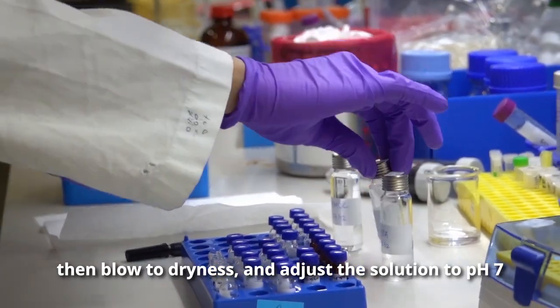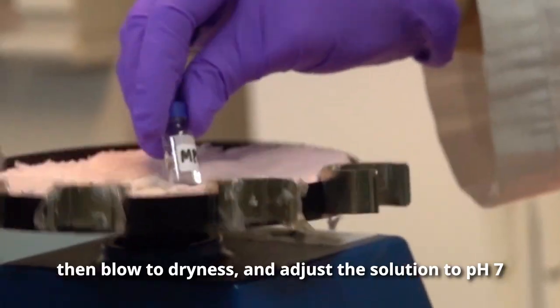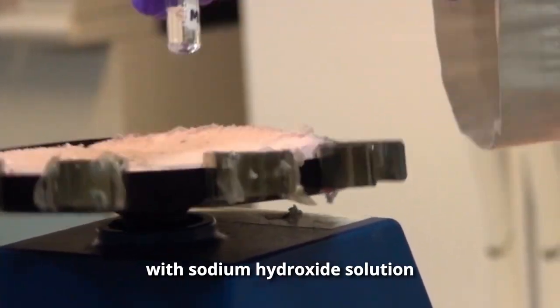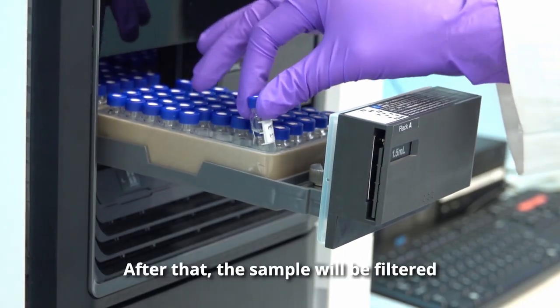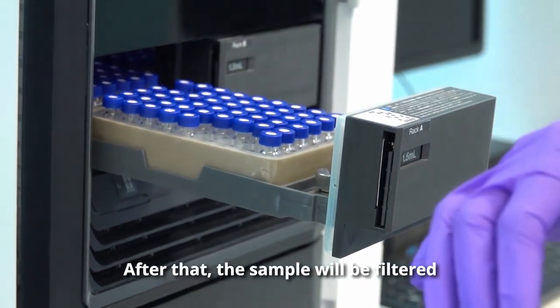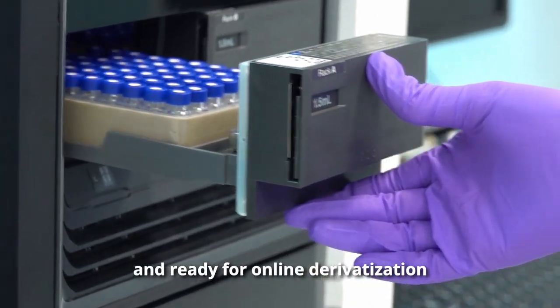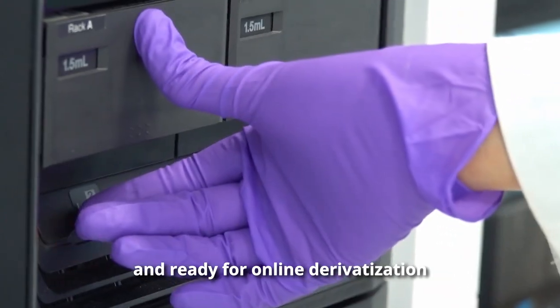Then, the sample is blown to dryness and the solution is adjusted to pH 7 with sodium hydroxide solution. After that, the sample is filtered and ready for online derivatization.